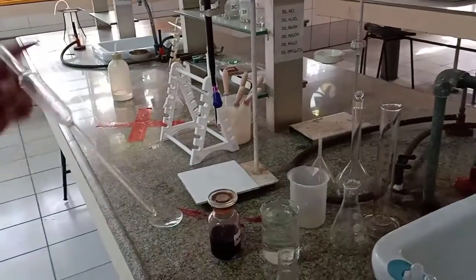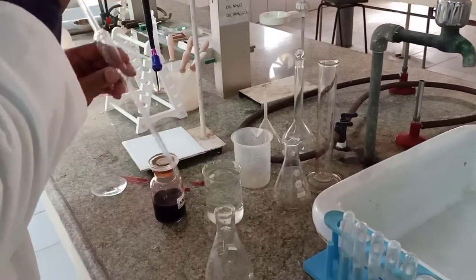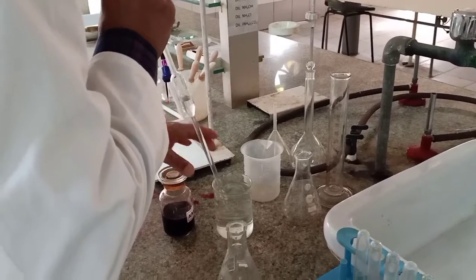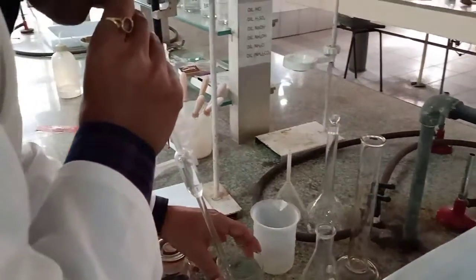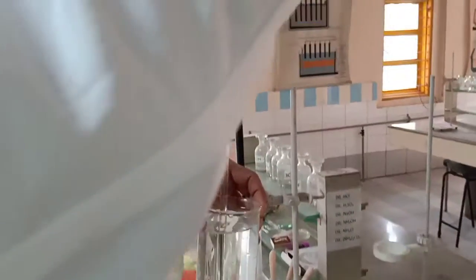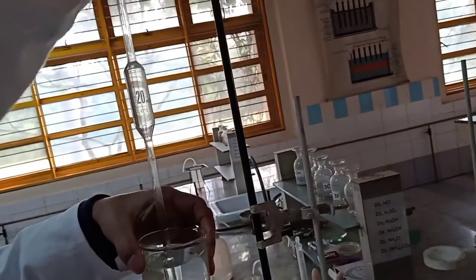Okay. Now we need to transfer. It's very important that you check the meniscus.